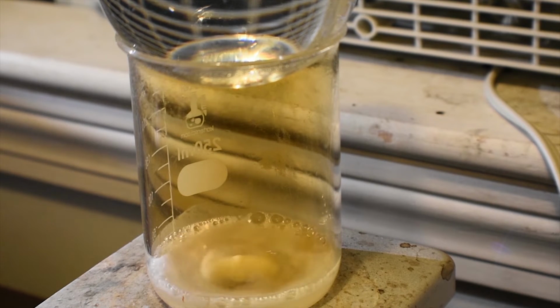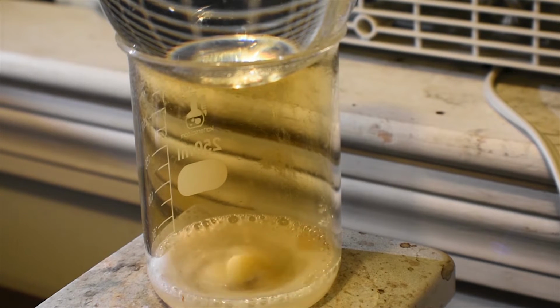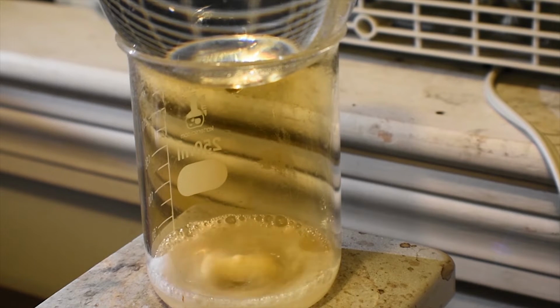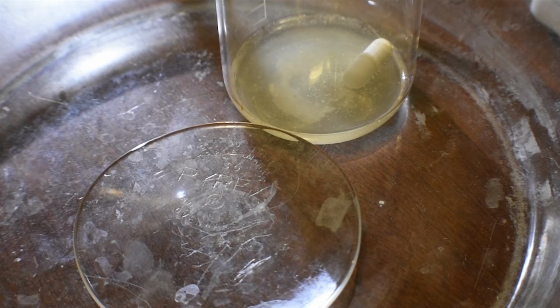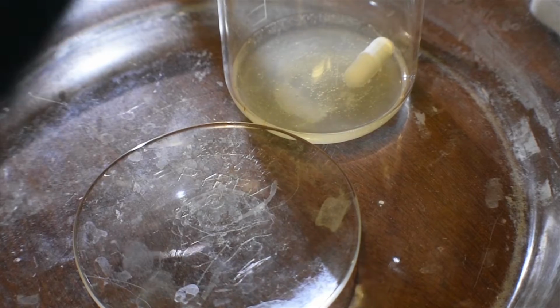Now I'm going to let this cool down to near room temperature, and then we can continue on with the synthesis. Actually, there's one cool thing we can do right now. Let me show you that. Here I have the reaction solution in the same beaker that was used for the reaction. And what I'm going to do here is take a little bit of the reaction solution up in a pipette, and then put it on a very, very cold watch glass. This watch glass has been in the freezer for about 2 hours.